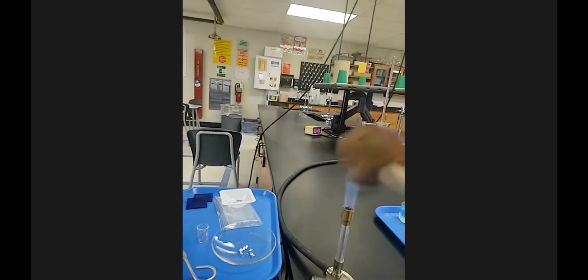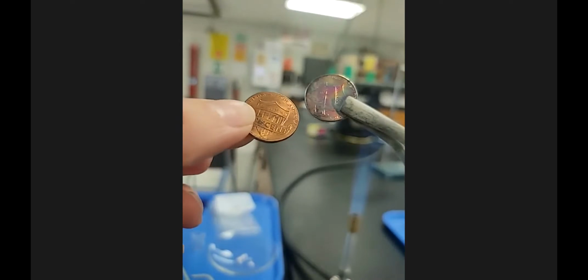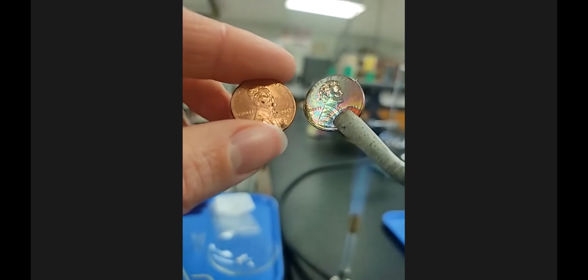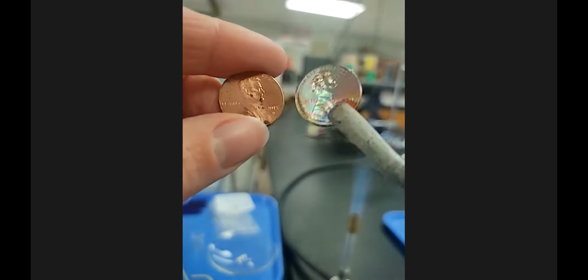Now, I'm going to get another penny for comparison because, again, this is a good lab technique. Your eyes are very bad at remembering what stuff looked like beforehand. And so here is a penny not heated up. Here's the penny that I just put in the flame. Okay. Let me show you this side, because this one says to observe it for a minute afterwards. This is 2015, but they're the same composition. And so you have a good comparison there.